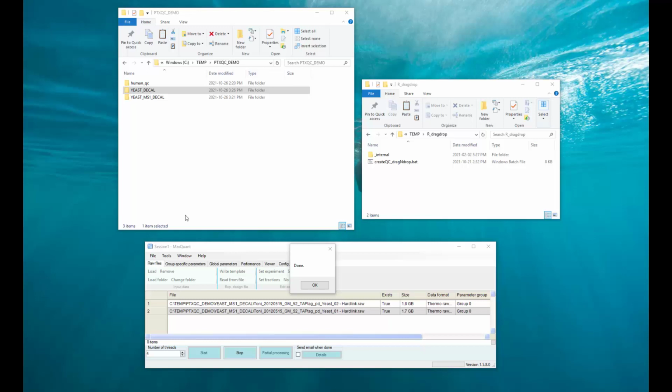So, welcome back. Let's put the drag and drop feature of PTXQC into action and inspect some reports. So what I have here is a MaxQuant run which just finished, and the folder on which MaxQuant ran is this yeast folder here. So let's quickly dive into that.